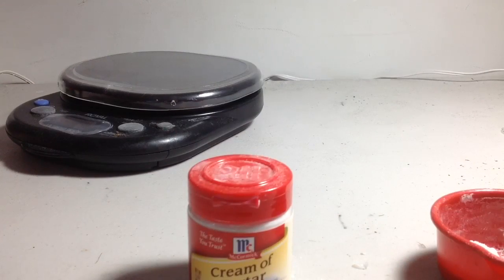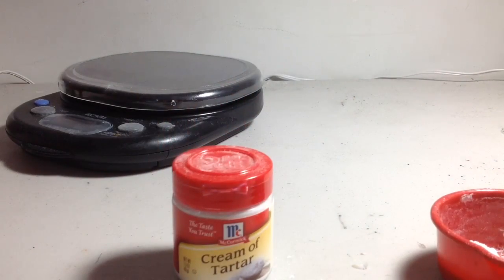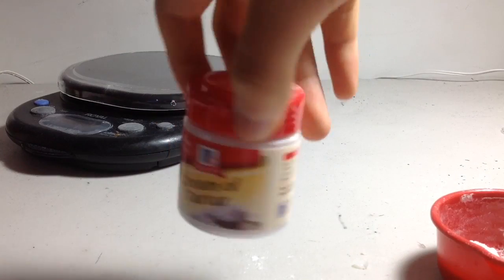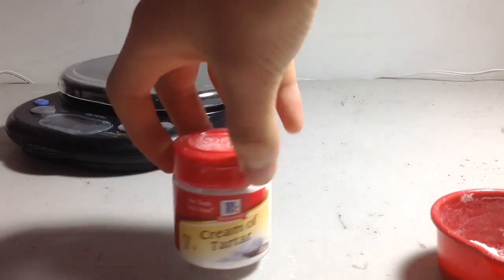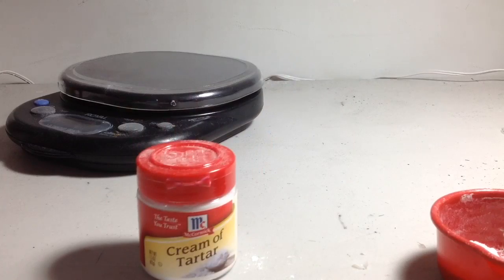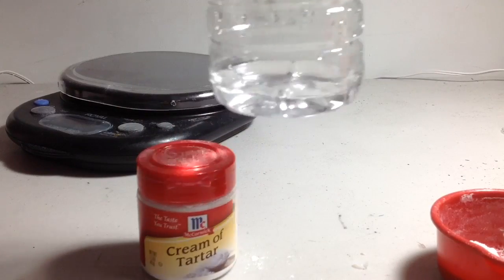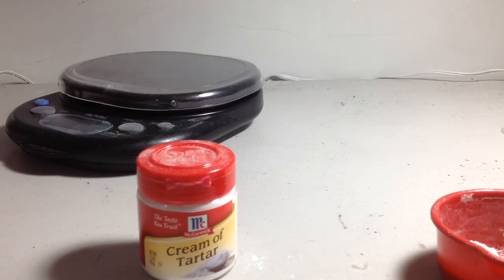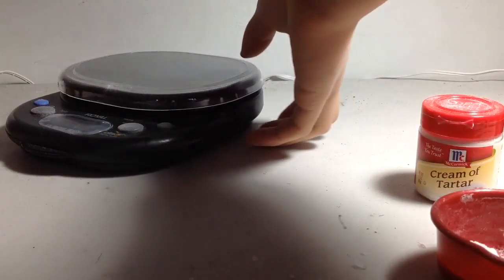Ideally, we should have 44 grams of cream of tartar and 100 milliliters of water. But this stuff is pretty expensive, so I'm going to scale down by 5. I got 20 milliliters of water instead of 100, which means we'll need about 9 grams. I'm going to weigh out 9 grams.